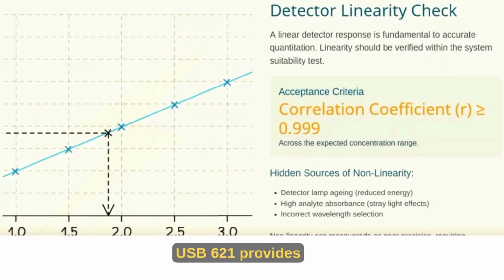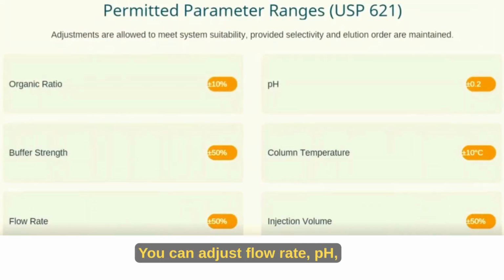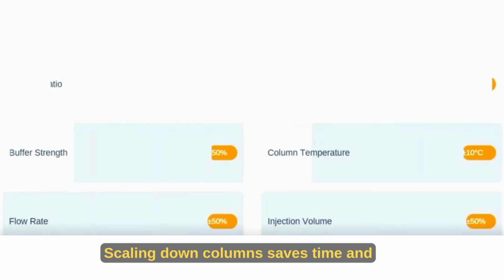Verify flow rate versus column ID. Every column ID has its ideal flow rate. Too high or too low creates turbulence that can split peaks. Stick to about 1 milliliter per minute for 4.6 millimeter ID and 0.4 milliliters per minute for 2.1 millimeter columns for best results.